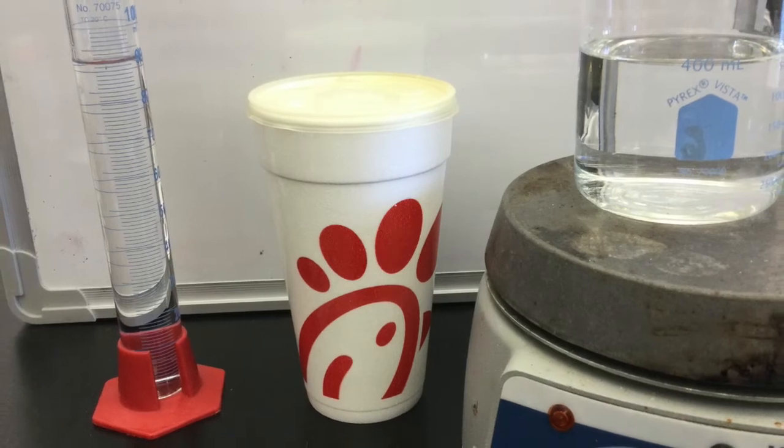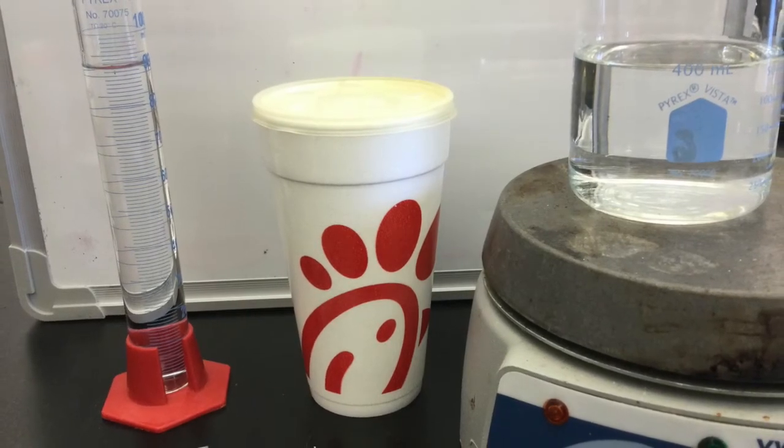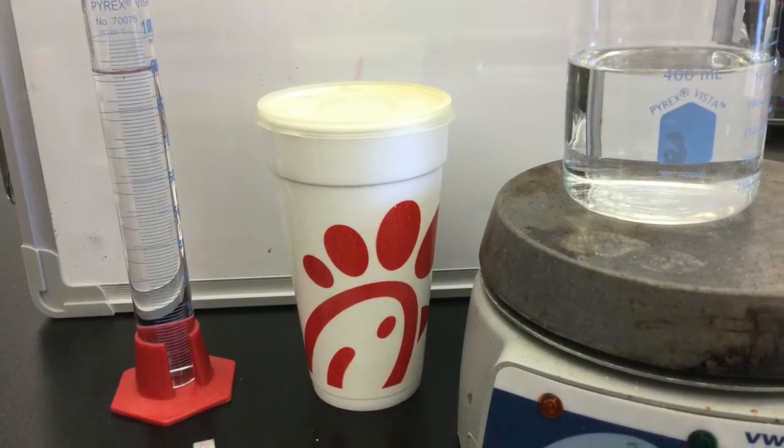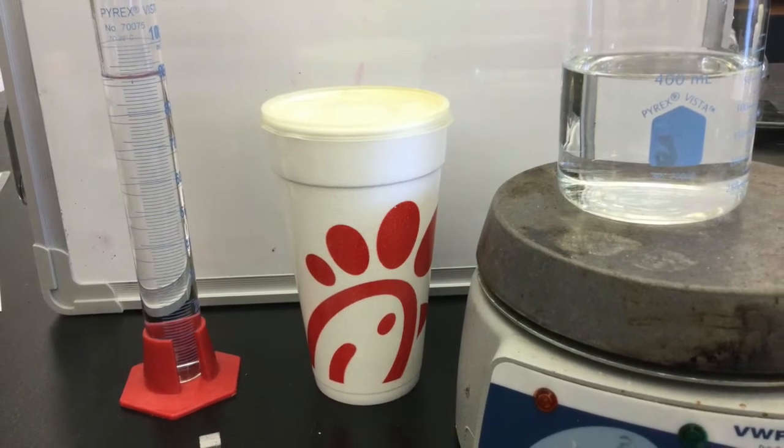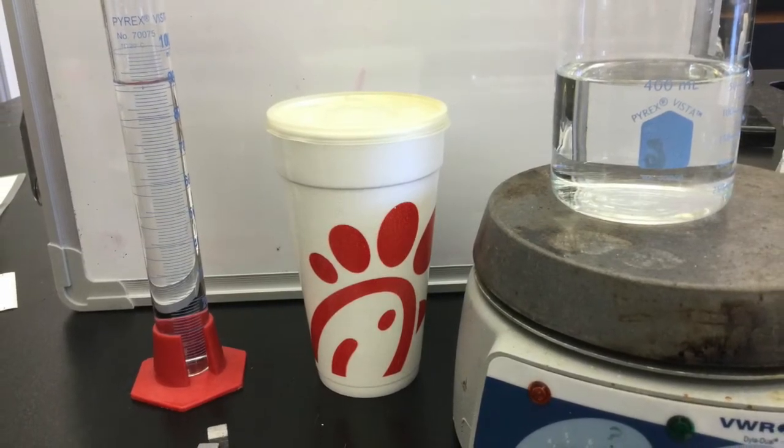This lab involves finding the specific heat capacity of an unknown metal. You will be using a Styrofoam cup as your calorimeter and a hot plate to heat the water and the metal.